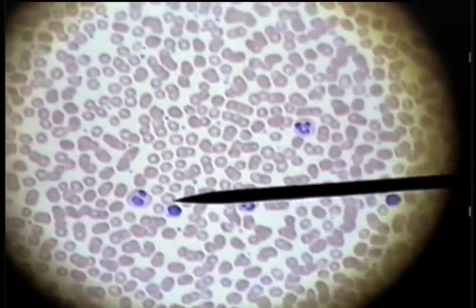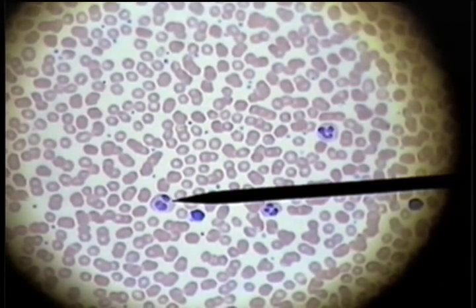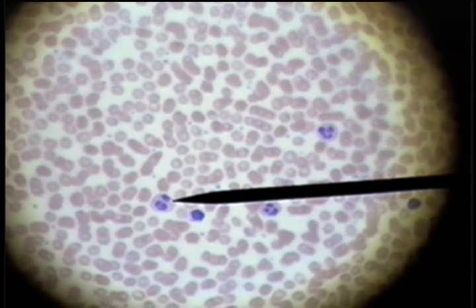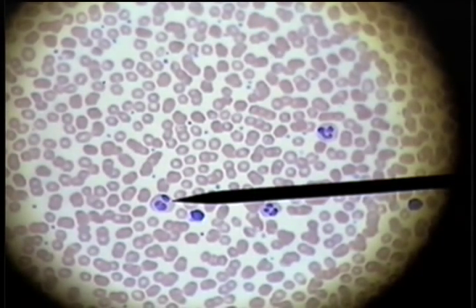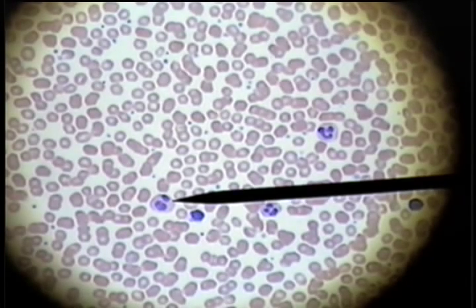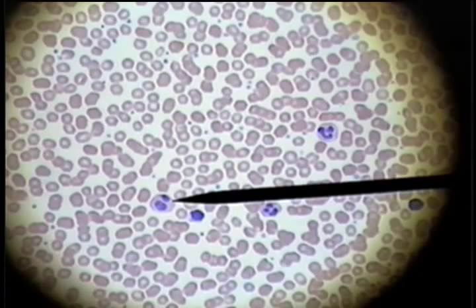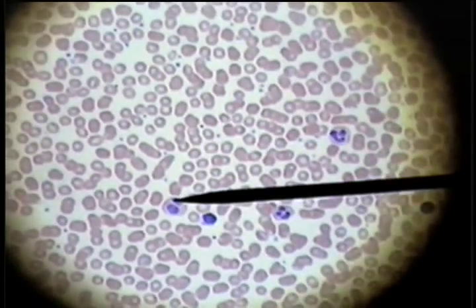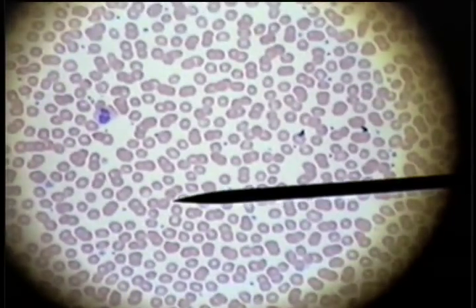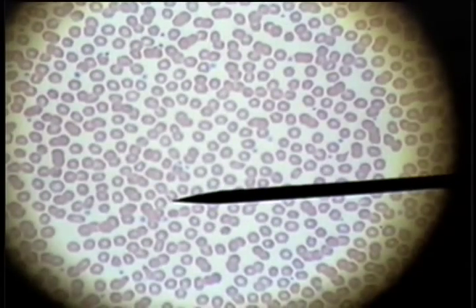This cell has a two-lobed nucleus, and although the color is not readily apparent here, these are orange granules. This would be characteristic of an eosinophil. And those are the cells that we would most commonly see associated with the blood picture.